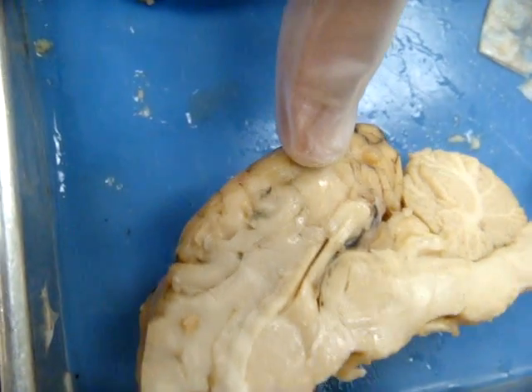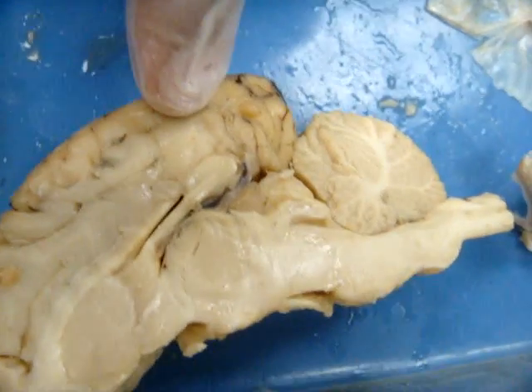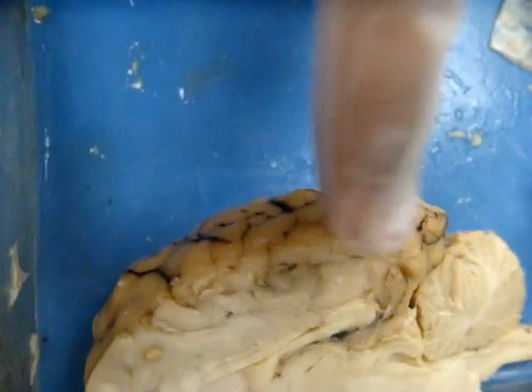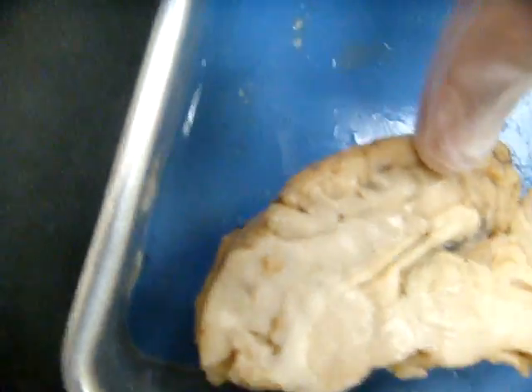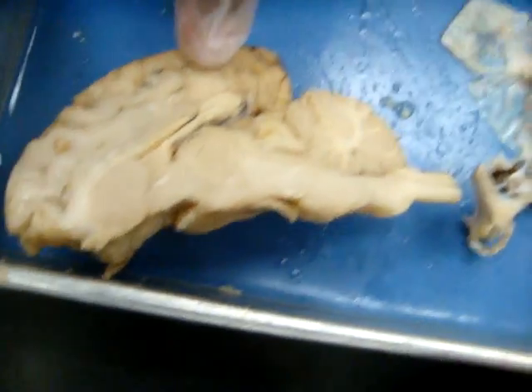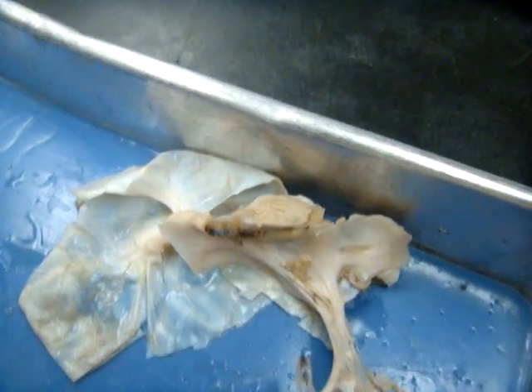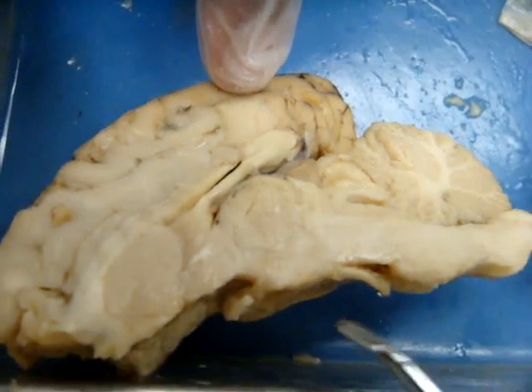Hypothalamus should be under the thalamus here. Pituitary — it got pulled off, but it looks like this. And it attaches under, right here, this area.